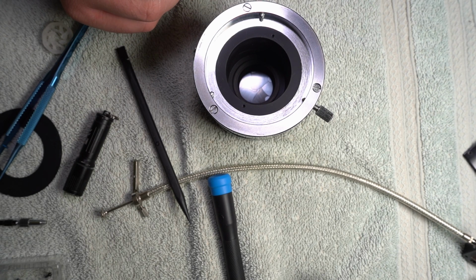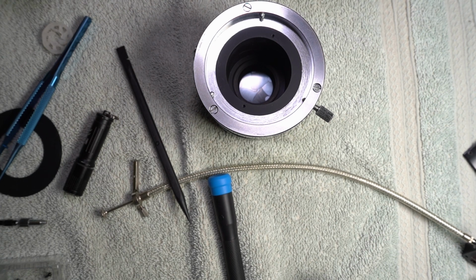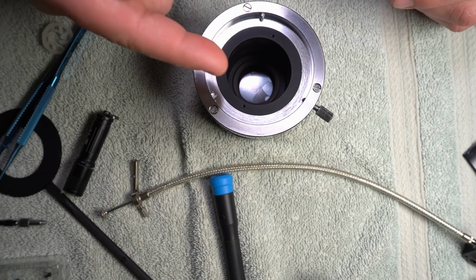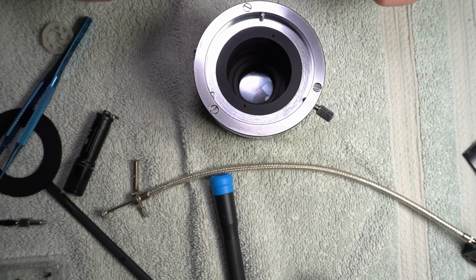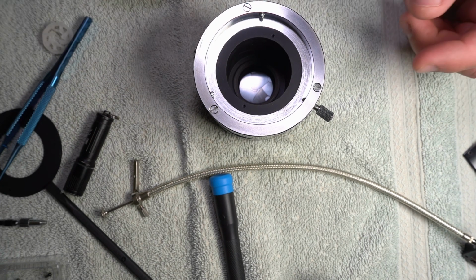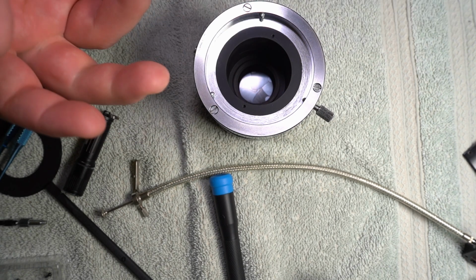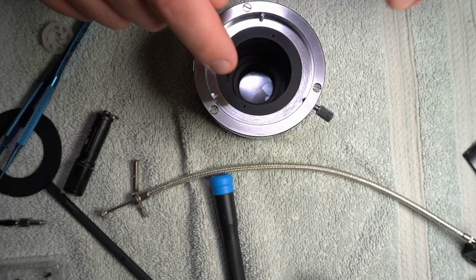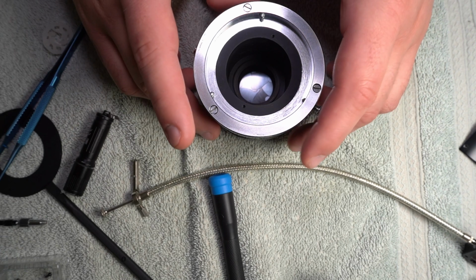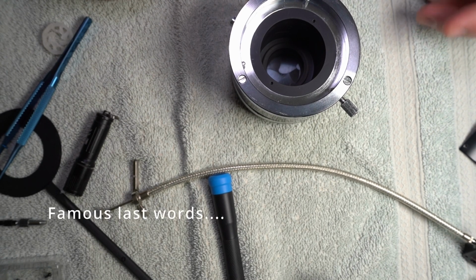It's stupid. I mean, it's a really important metal, but the way it works is kind of frustrating. Aluminum, they have this anodized textured stuff on it, and it makes for the worst feeling threads, and also it's really hard to get on there because there's no weight to the thing, so any movement is just, oh, I'm gonna move now. If you touch it, it just boings out of where you wanted it to be. So now I've got that part together. Now this is frankly the easy part at this point.